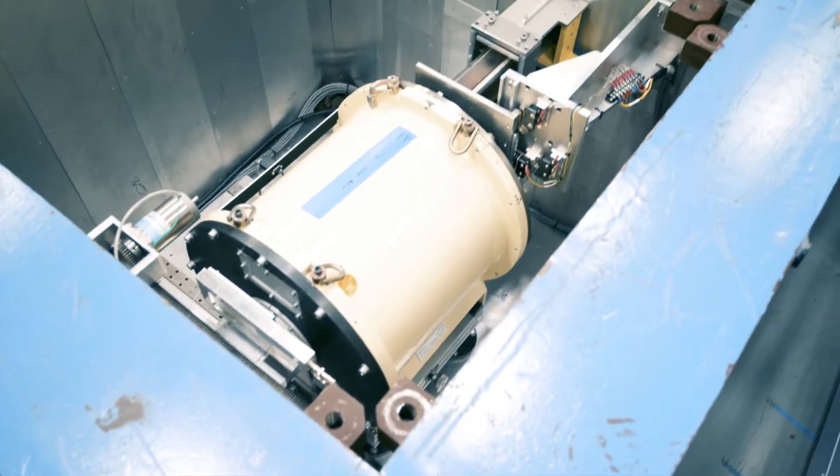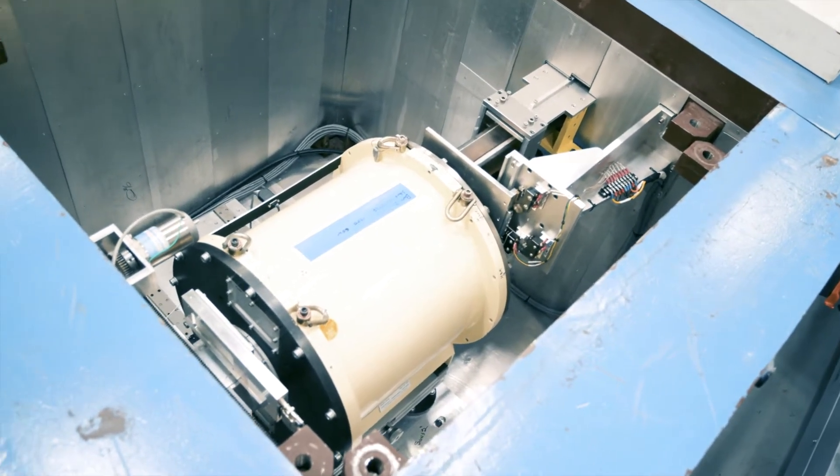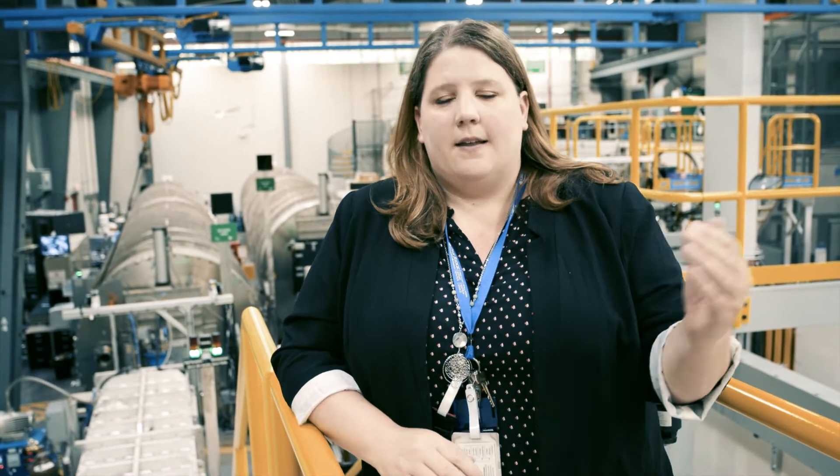Then we come up to the first part of the instrument, which is the velocity selector that helps us monochromate our beamline — select a wavelength or an energy that we want to look at — with a bandwidth of 13%, and through settings we can reduce that down to about 8%.